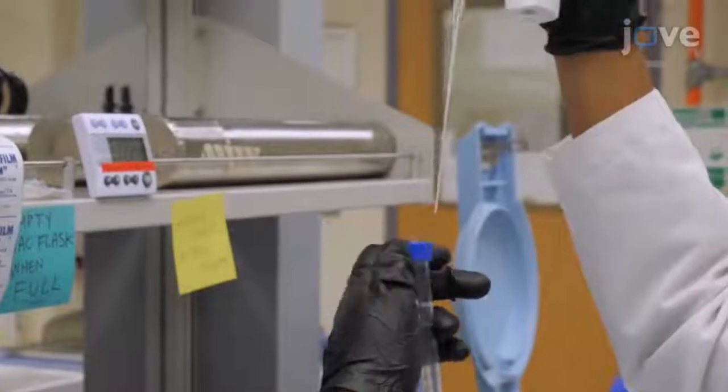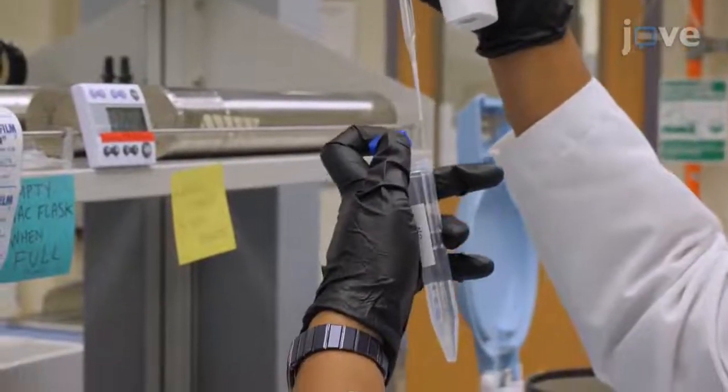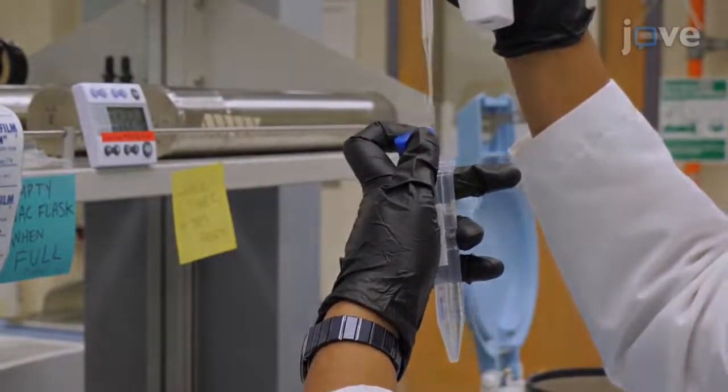Following the wash, move the egg pellet to a fresh 15 milliliter tube containing approximately nine milliliters of M9 buffer to synchronize the population.